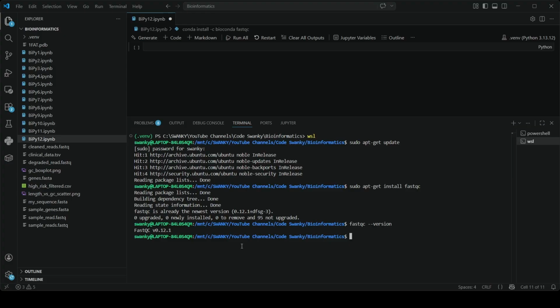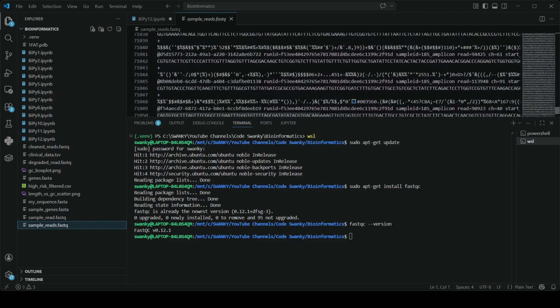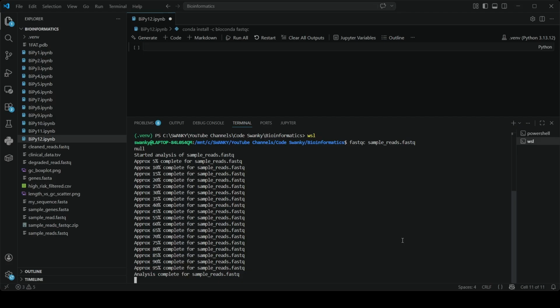I have downloaded a small FastQ file, not exactly small, but it has quite a bit of reads over here. We will be running FastQC on this file, and it will take exactly one line of code. So let's run fastqc, then we will enter the name of the file, sample_reads.fastq.